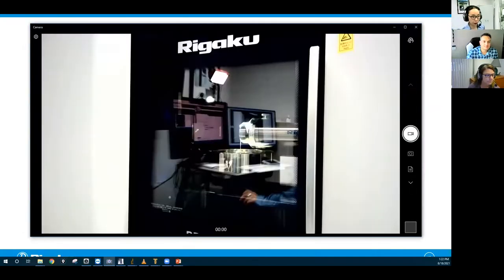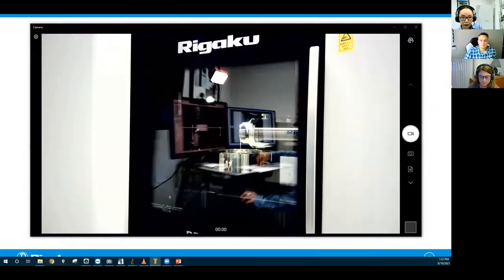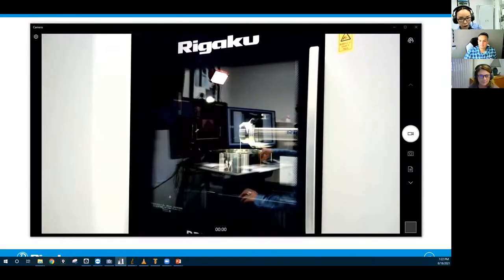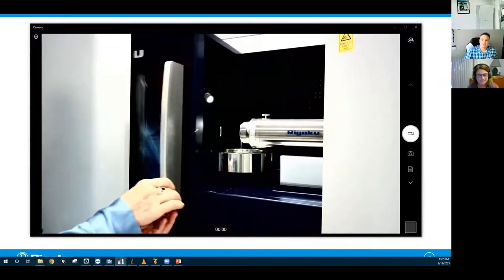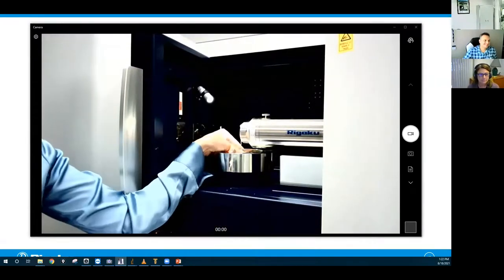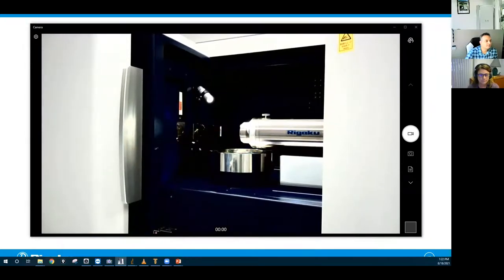I'm going to put the bigger and longer one then. Let me switch the camera. Okay. If you're wondering what I'm doing, I'm trying to get to the data collection software to unlock the door. And I have too many windows open, so let me get the seed out. Okay. In one sec, I need a base for this.